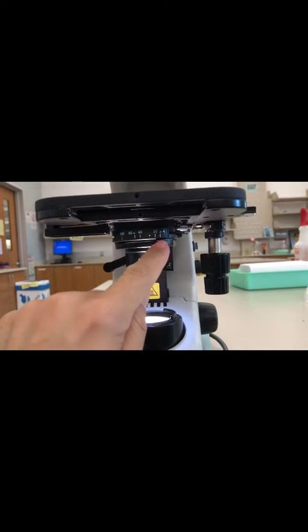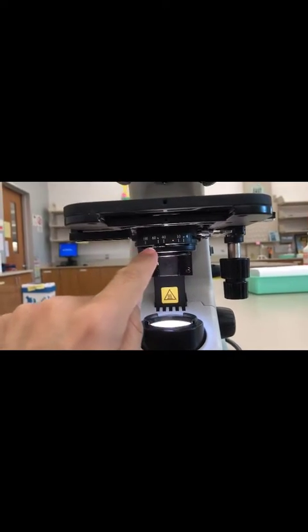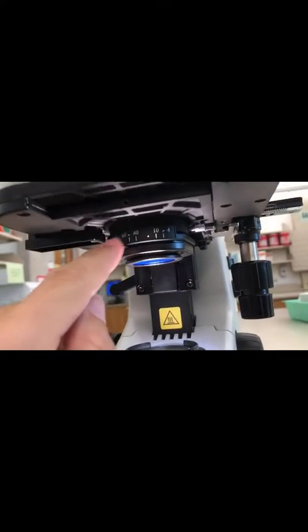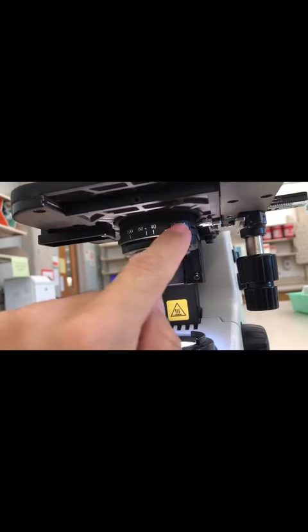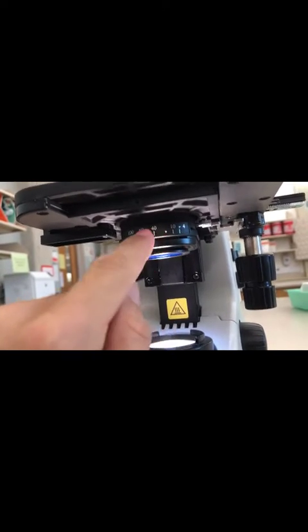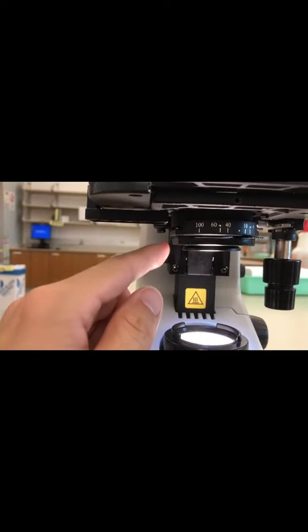Just a quick rundown. This little lever here, in case you're wondering, is called the iris. It's a diaphragm and it limits the light that goes through the condenser. You can see here that it adjusts the light. If you turn it dim, it actually increases contrast.